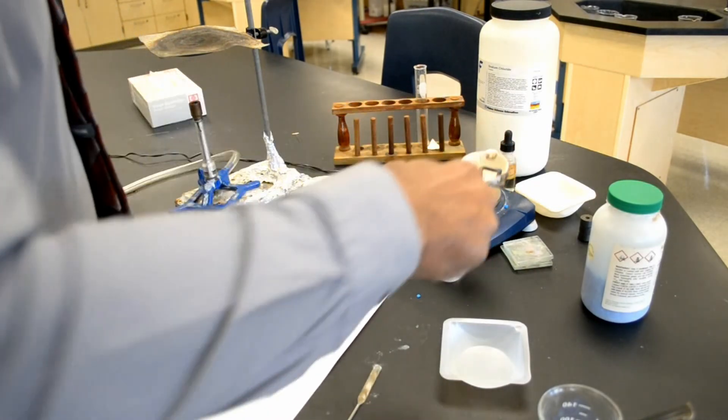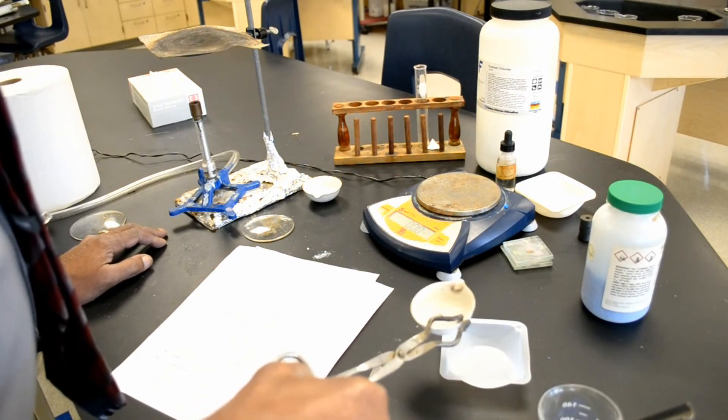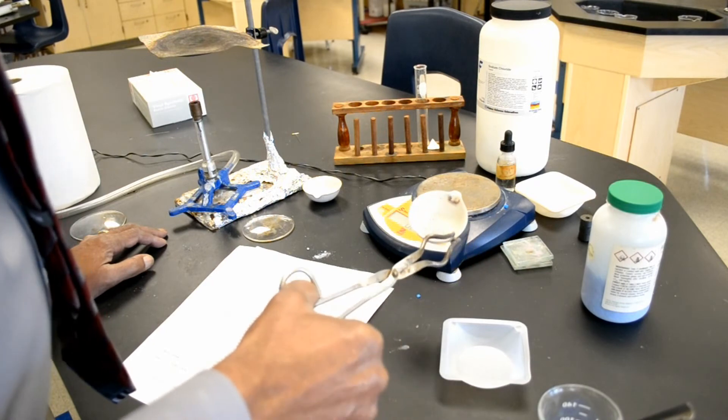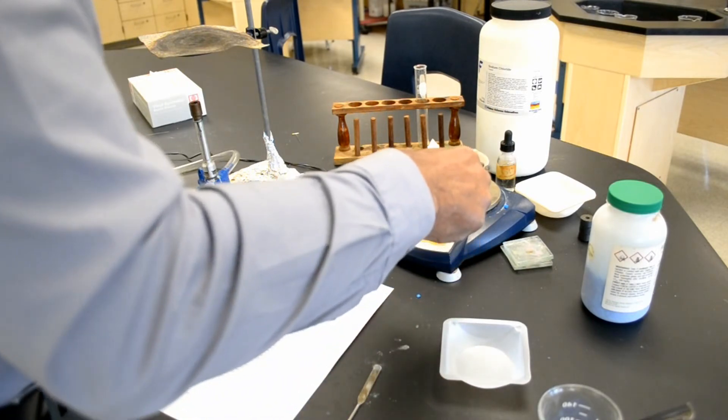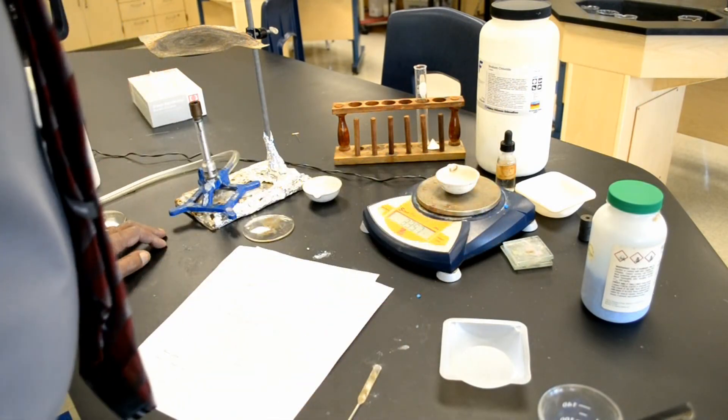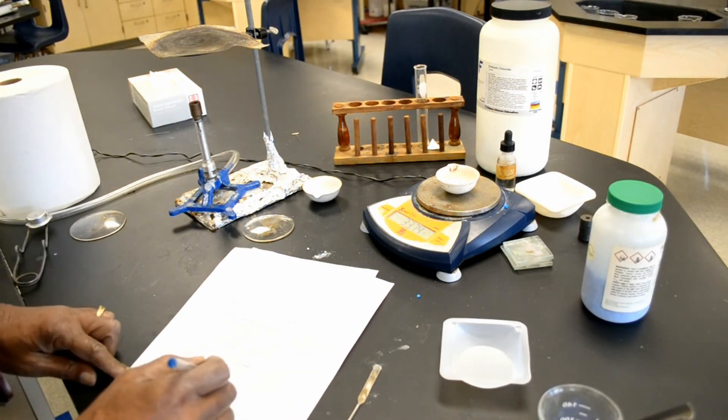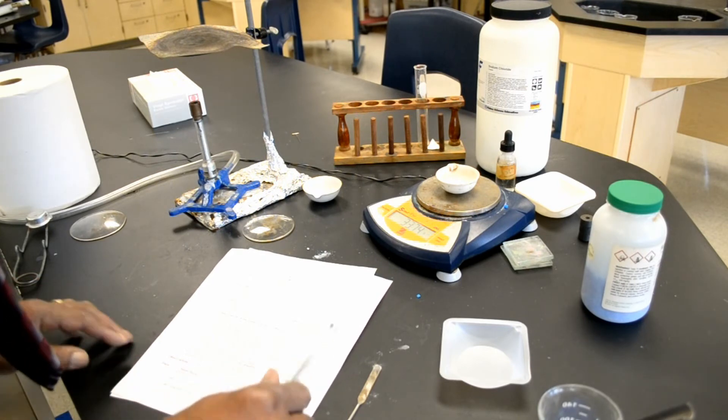Now, it says wait two minutes before you mass it. But I'm actually going to mass it now because as the hydrate sits in the atmosphere, it will take on water again. I'm now going to mass it, and the mass is actually 33.74.